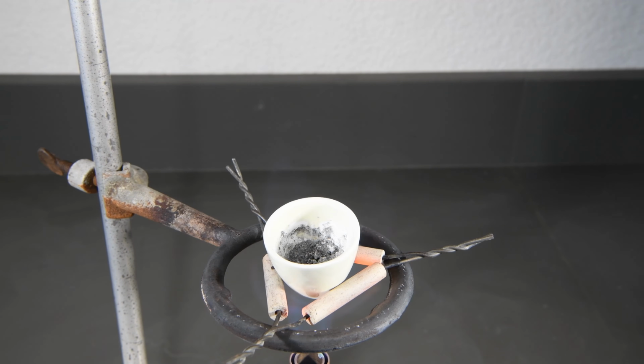We've been heating it now for 5 minutes. And there's no more flashes of light, and it looks like a dull gray powder, so it appears that we're done. So we can go ahead and turn off the Bunsen burner now, and we'll let it cool for about 5 minutes. And then once it's cooled, that next step will be to add water to convert any of the magnesium nitride into magnesium oxide.